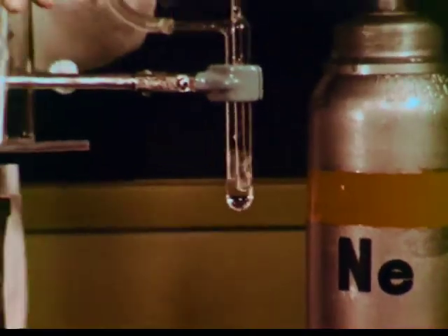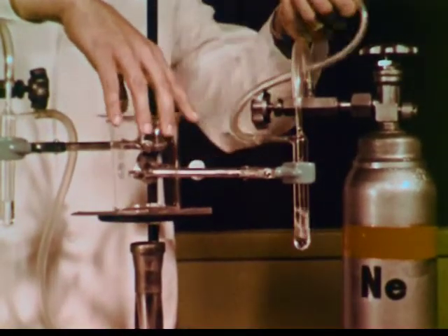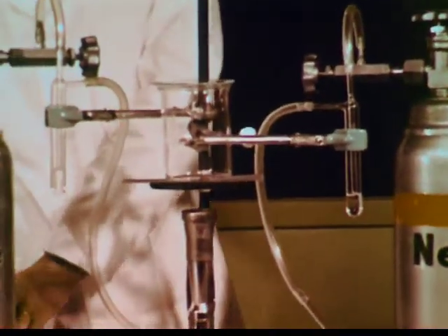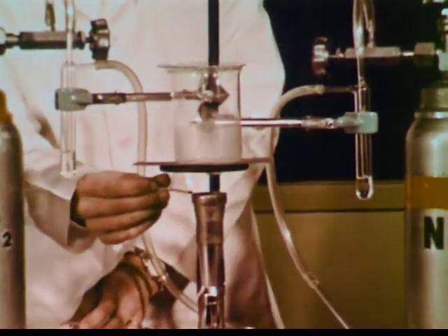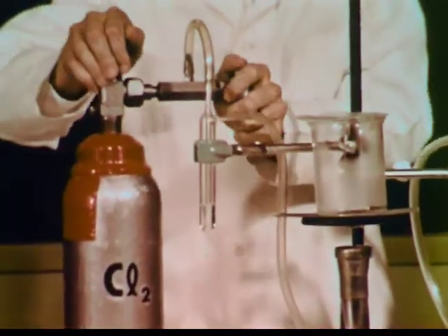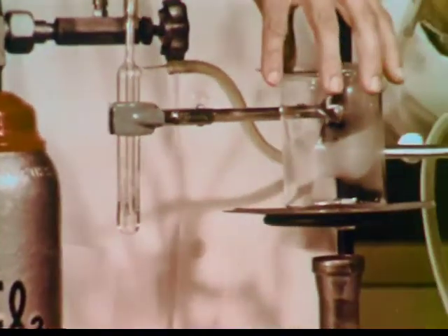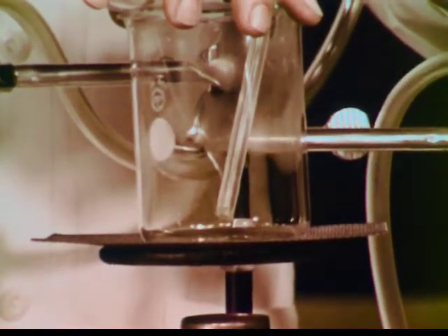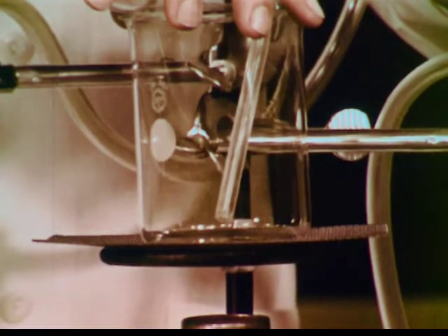Neon is the element just preceding sodium in the periodic table. It has only one electron less. Let's see if neon reacts with chlorine. First, the beaker is filled with neon. Then it is heated, just as we heated the sodium. Moisture condenses on the outside of the beaker at first, but it disappears as the beaker warms. Now, as chlorine gas is added, it can be seen mixing with the hot neon gas. Yet, no reaction occurs. Neon is inert, in contrast to sodium.